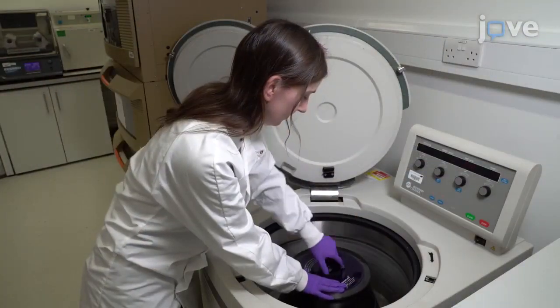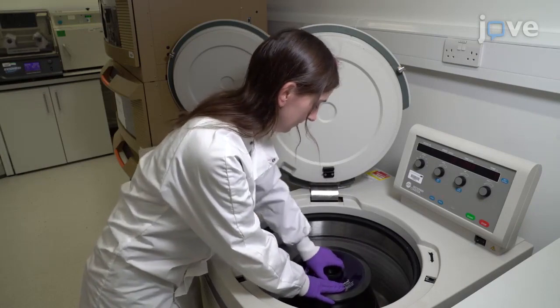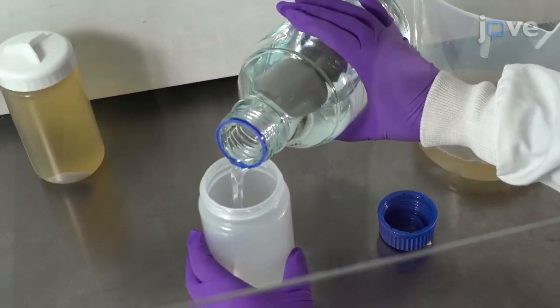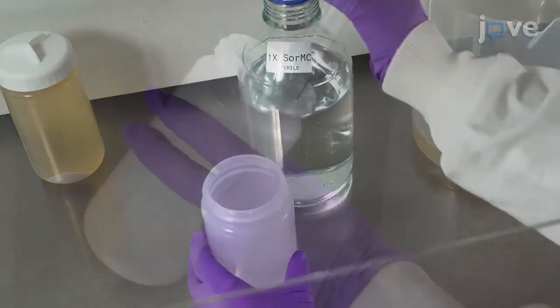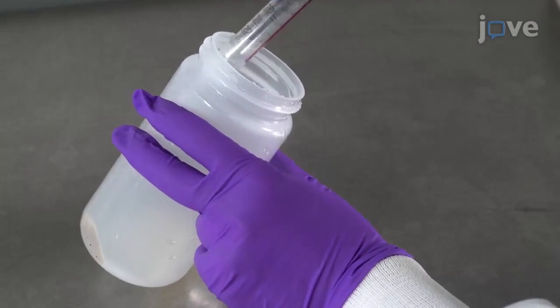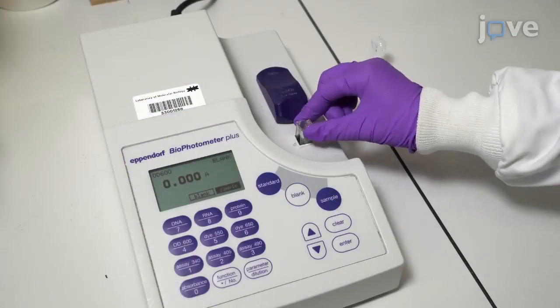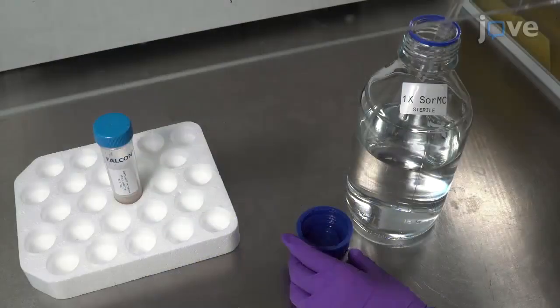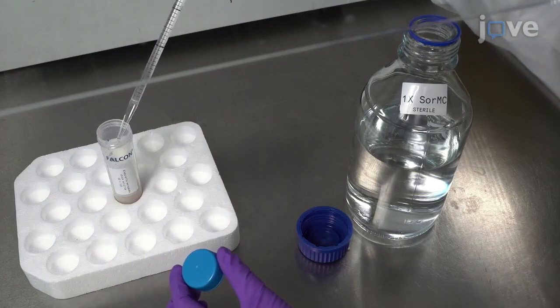Spin the cells down in two 500 mL centrifuge tubes to harvest the cells. Then wash the bacteria once with 500 mL of buffer. Re-suspend the pellet in 20 mL of buffer. Use a photometer to check the optical density of the sample and dilute the sample with buffer until the optical density is about 100.